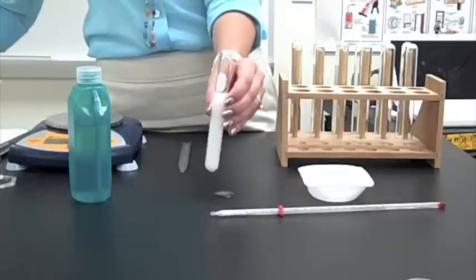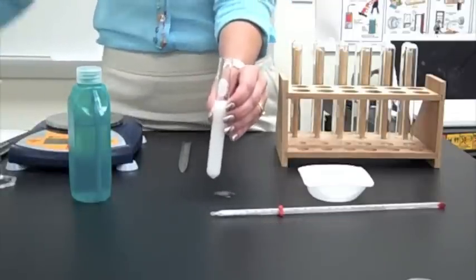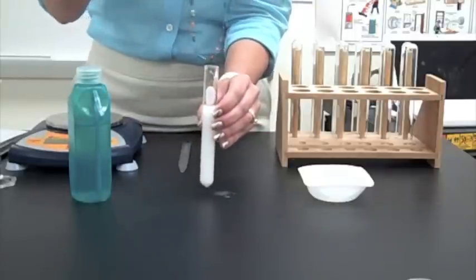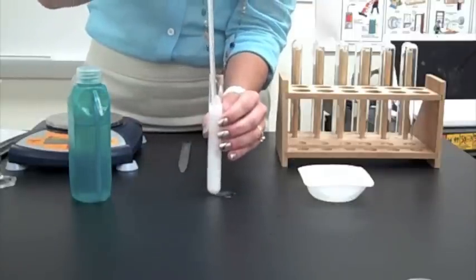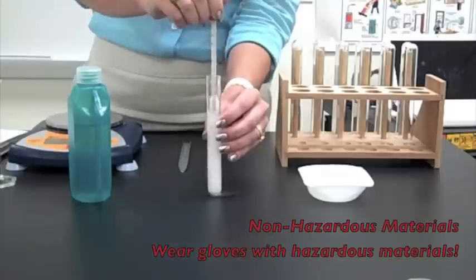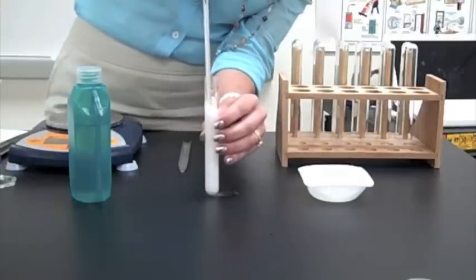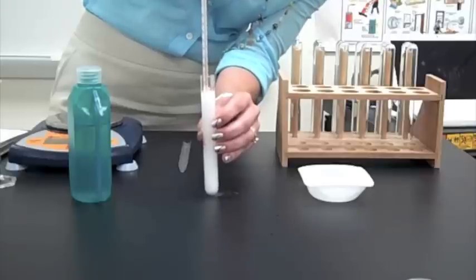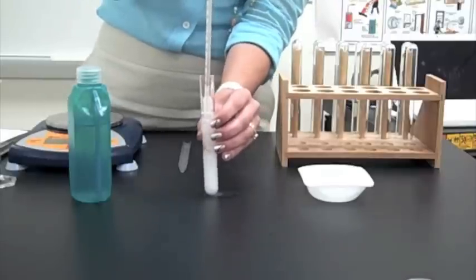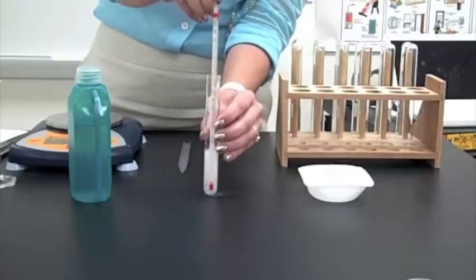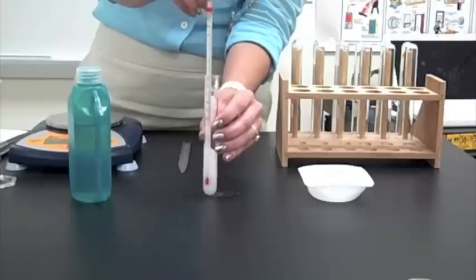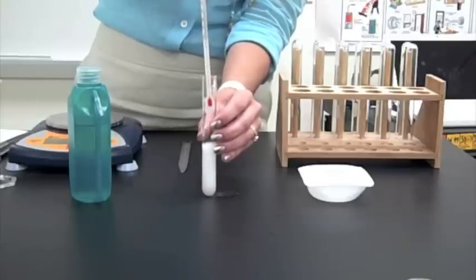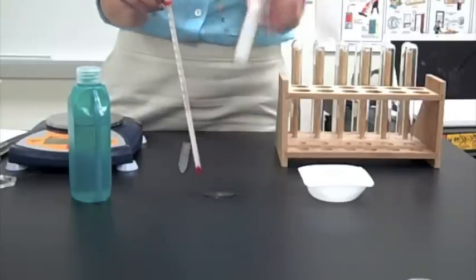Once the reaction has gone on for a little bit, you now need to take the temperature again. Alright, so the new temperature reading is 15 degrees Celsius. We've lost 8 degrees right here just in doing this reaction. Interesting. We'll talk about what kind of reaction that is later.